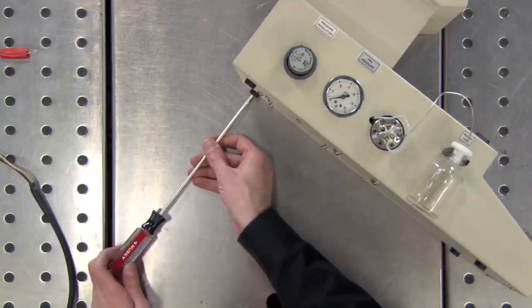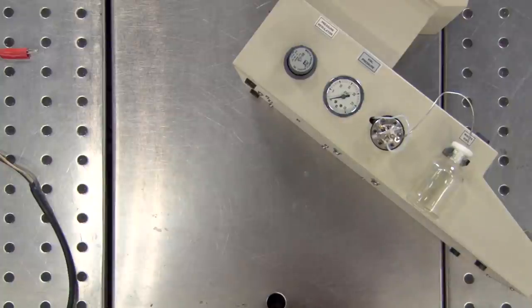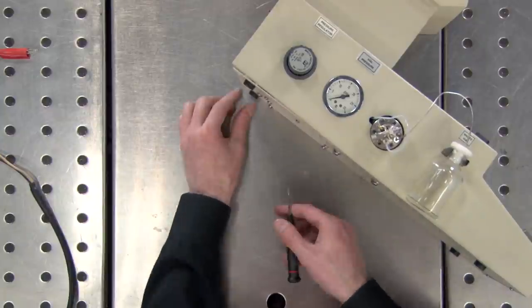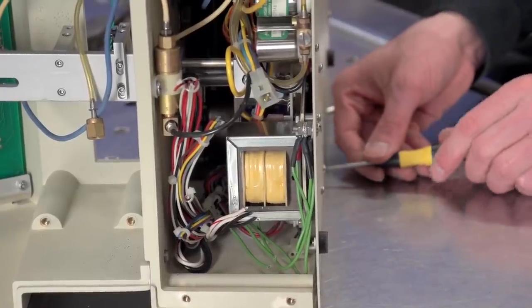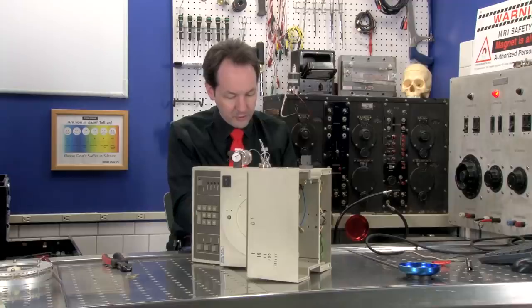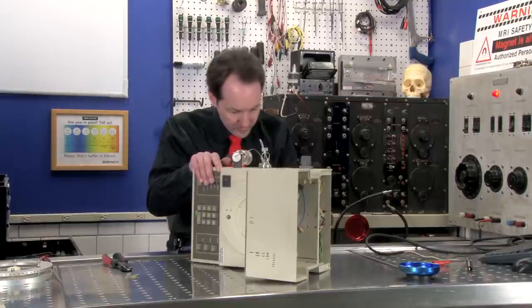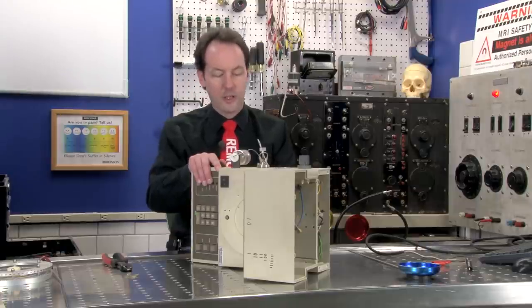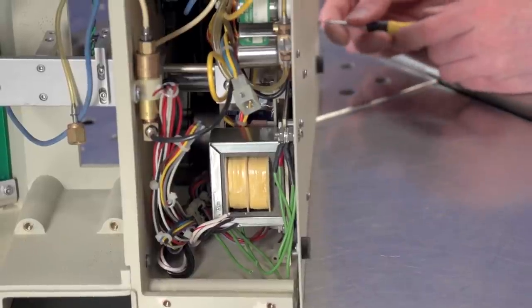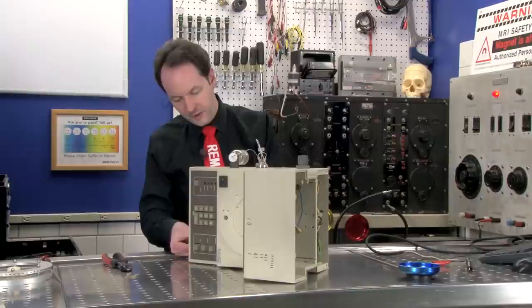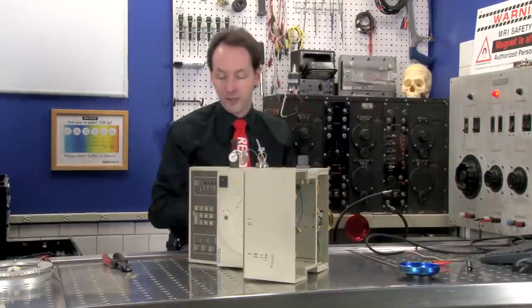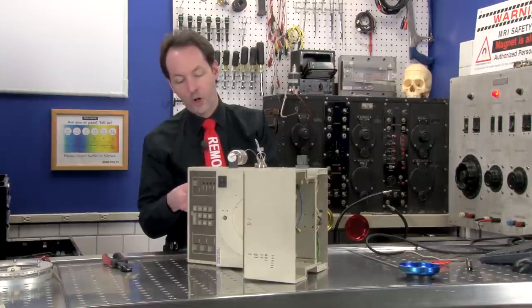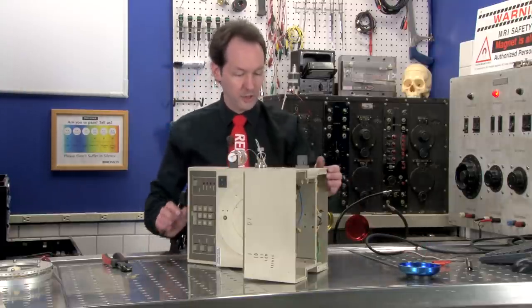Because chemistry equipment has all kinds of, especially when you get into any kind of scientific big testing equipment you take apart, you tend to find really unusual and fun things inside. You have to be careful, because some of them can be just way more dangerous than you were expecting. You know, you're not taking apart toasters.